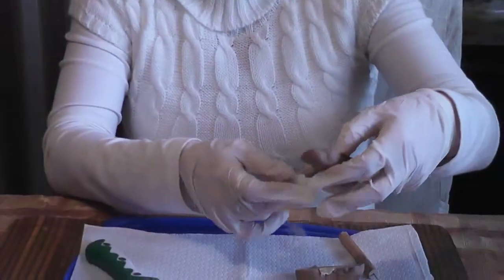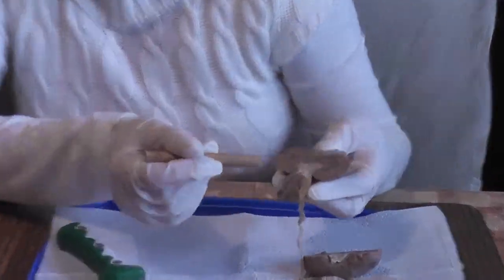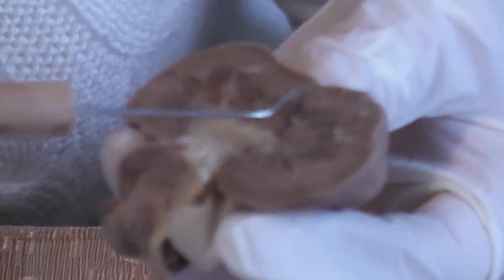So let's see. Now right here in the middle, inside the kidney, you can see the two major regions. This lighter outer portion, lighter brown color, is called the renal cortex, and this is where most of the nephrons are located. Also, you could kind of see the striations a little bit here, and those are the interlobular arteries and vein that are located in the cortex layer.